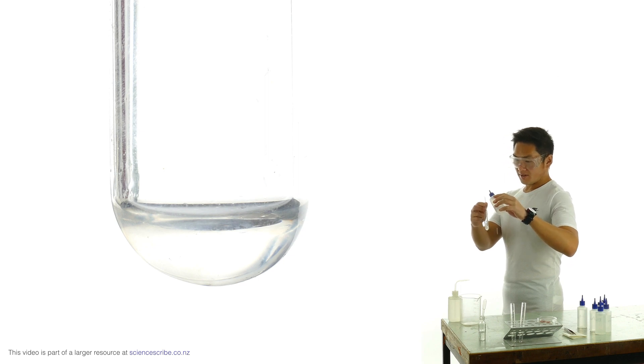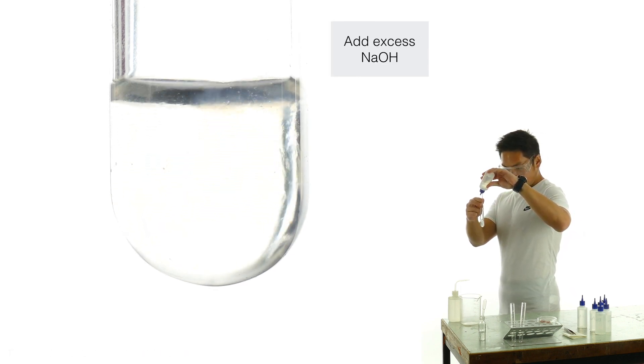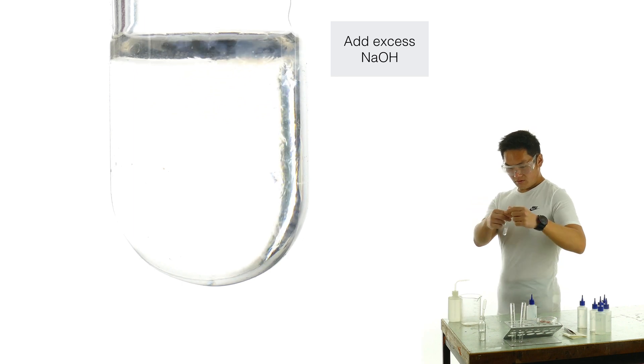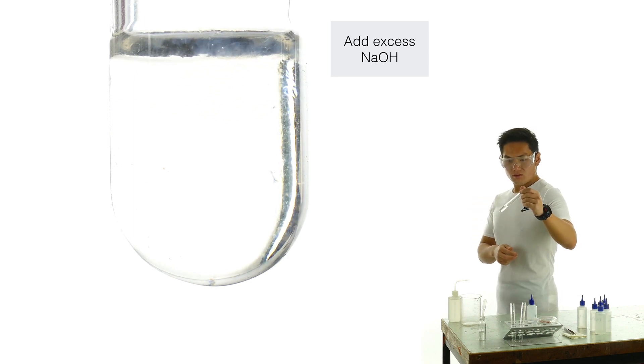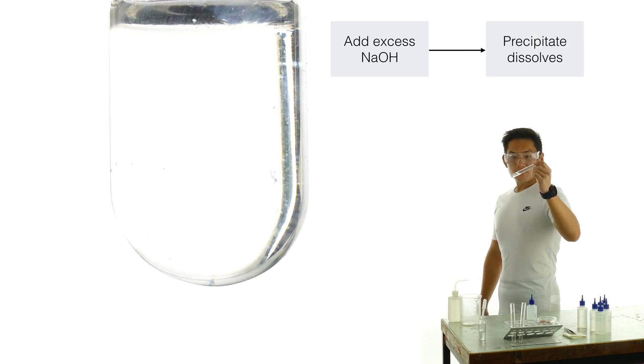I'm going to add excess sodium hydroxide. And now it's gone clear and colorless.